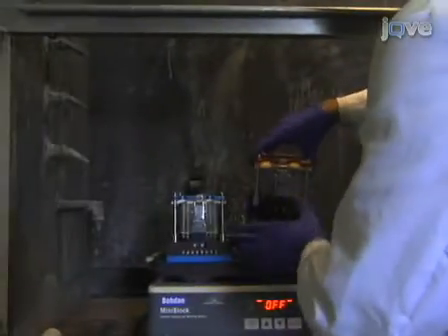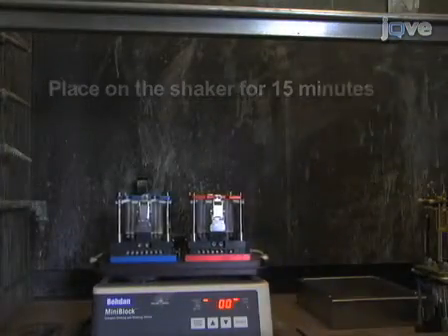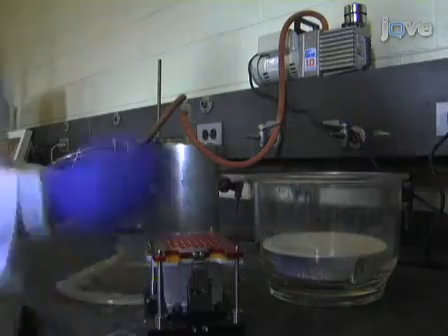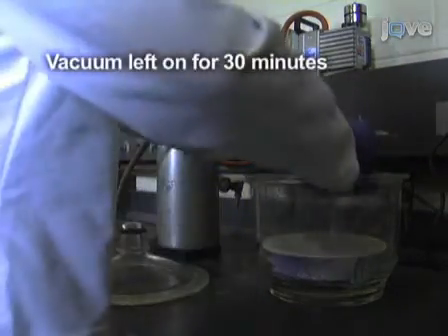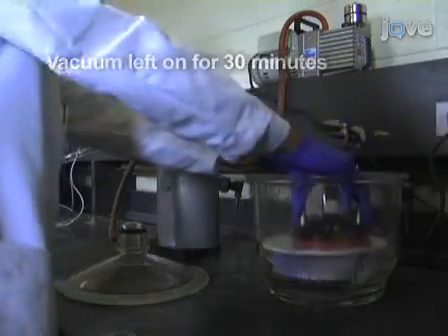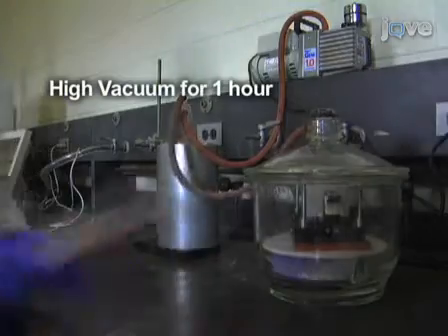The MiniBlock is put on the shaker for 15 minutes. This washing step is repeated once more. After the last wash, the vacuum is left on for 30 minutes. Then the tubes are transferred to a desiccator under high vacuum for 1 hour.